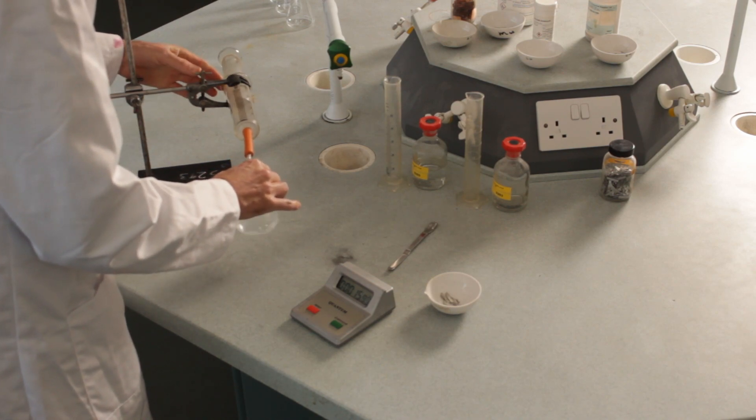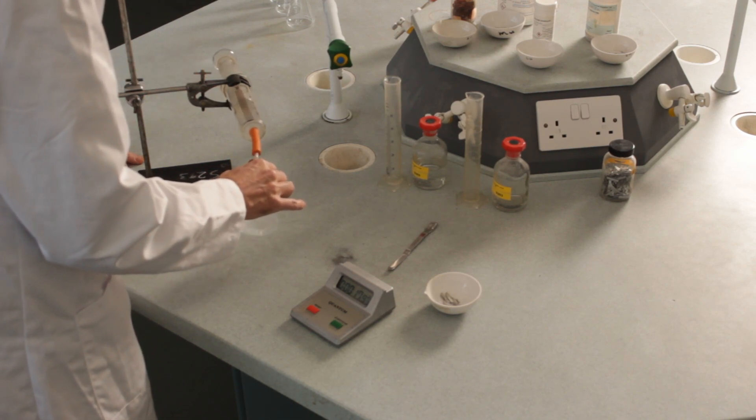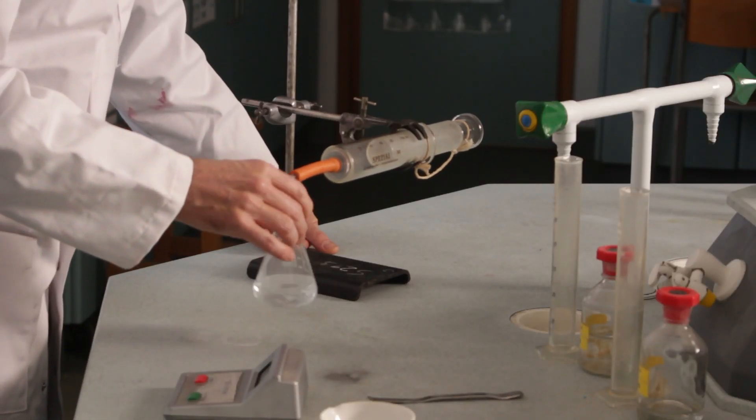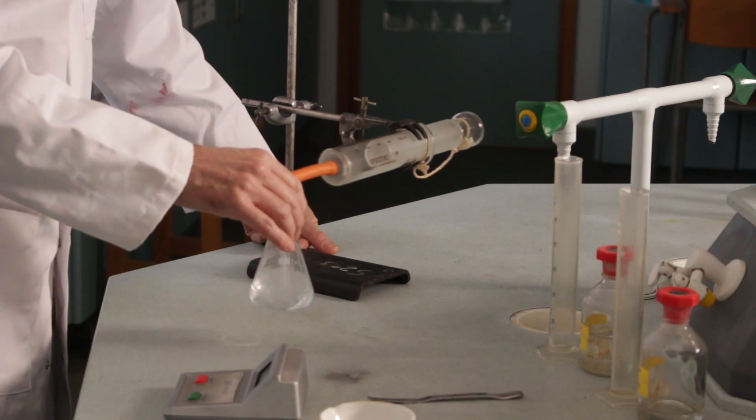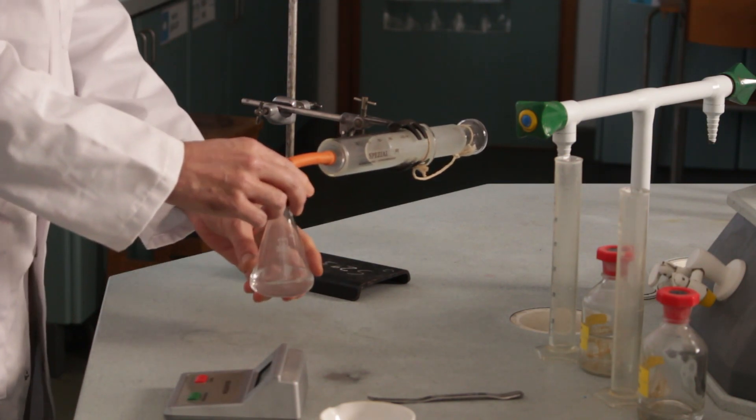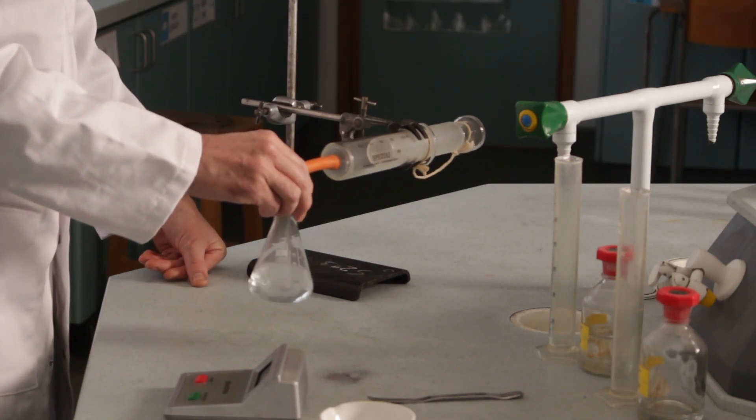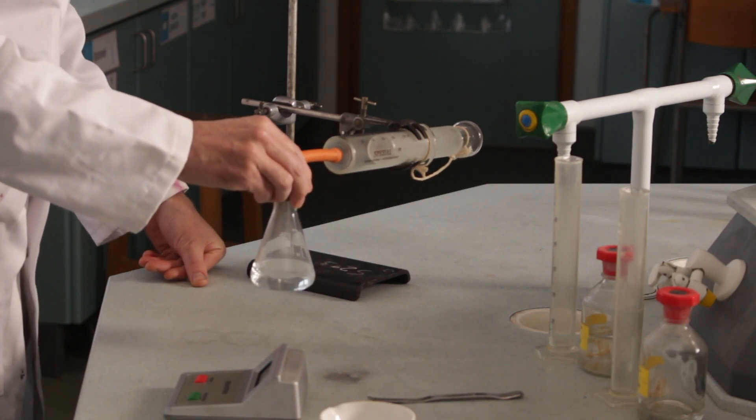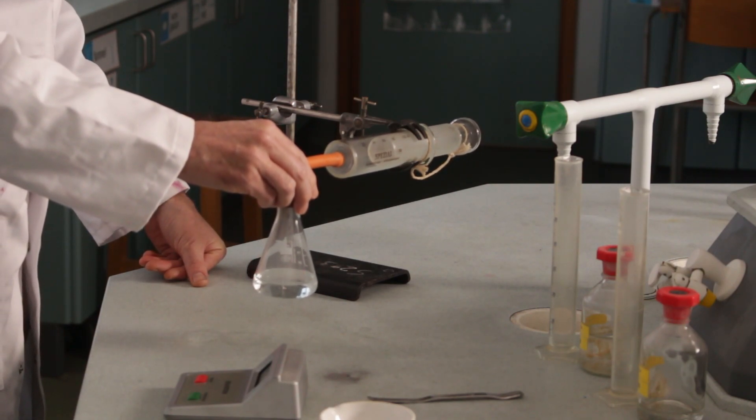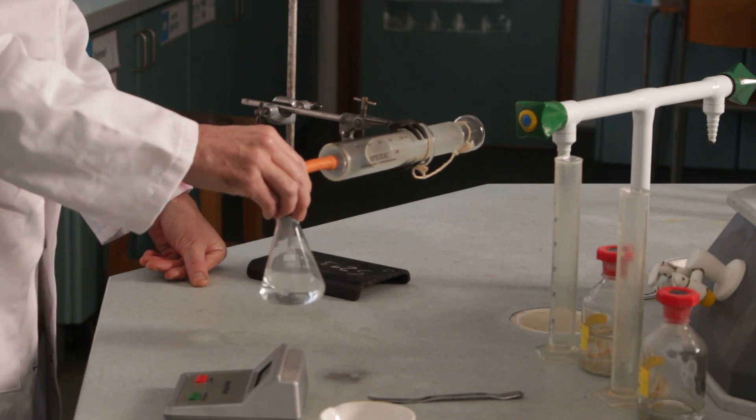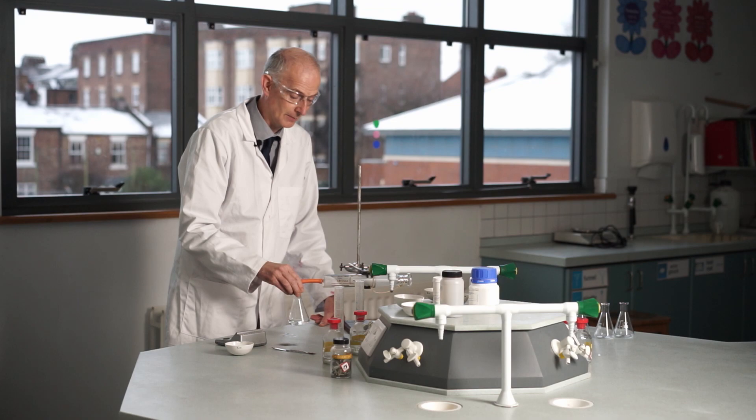Oh, and it stopped. So you might want to work out why it went up so quickly and then it's actually stopped. It's only 30 seconds in and it's no longer moving back. Okay, so there's a reason for that. And if you can think about it, try and work out why the reaction has stopped. Whereas the last one kept going even beyond the minute mark.